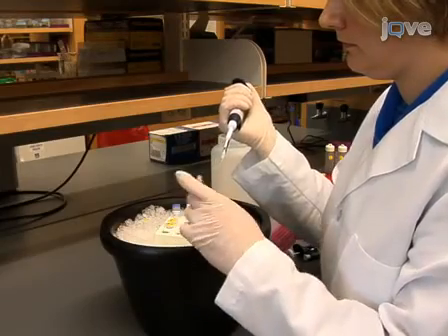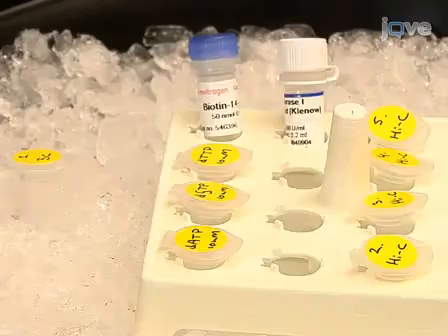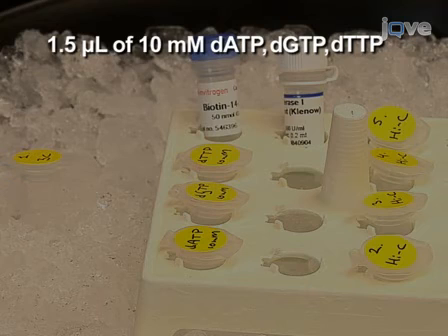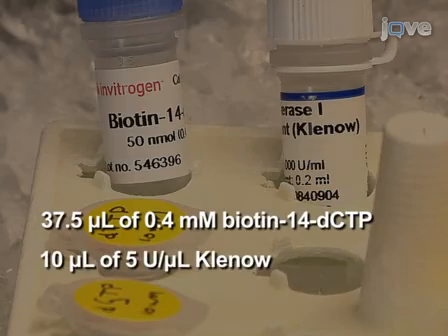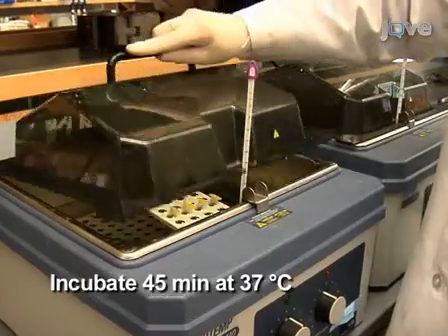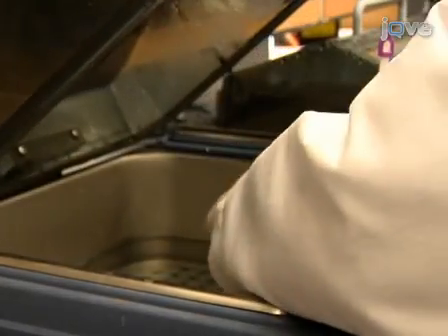To fill in the restriction fragment overhangs and mark the DNA ends with biotin in the remaining 4 tubes, add dATP, dGTP and dTTP to tubes 2 to 5. Also add biotinylated dCTP and Klenow. Mix carefully and incubate for 45 minutes at 37 degrees Celsius. Following incubation, place the tubes on ice.